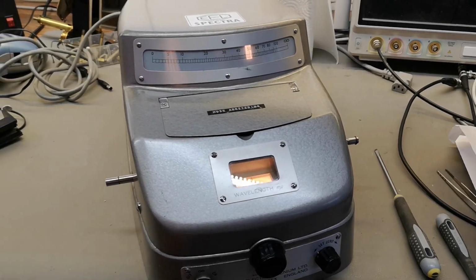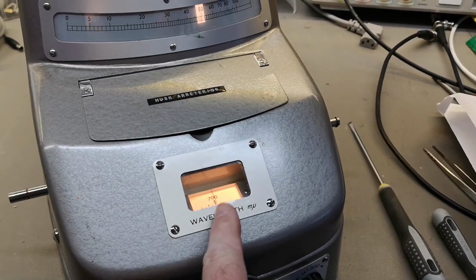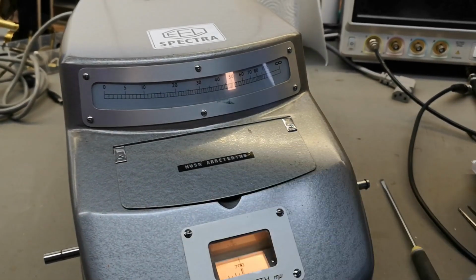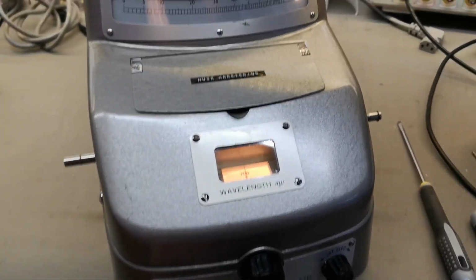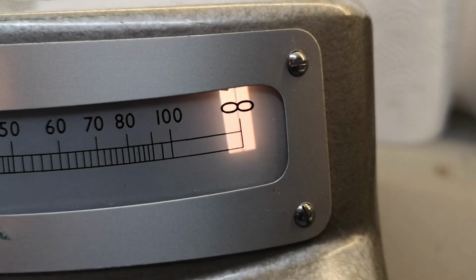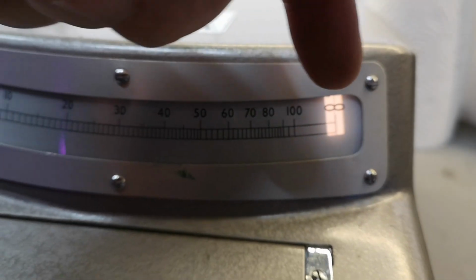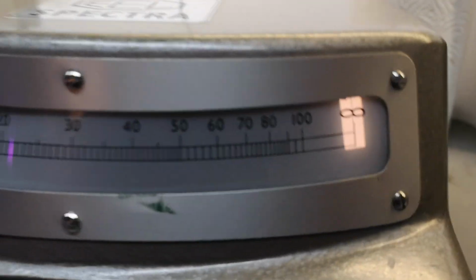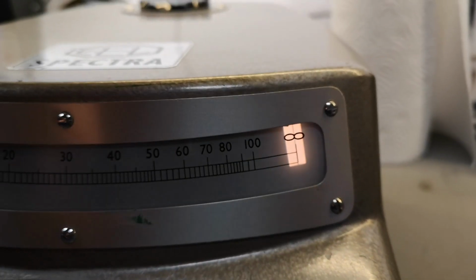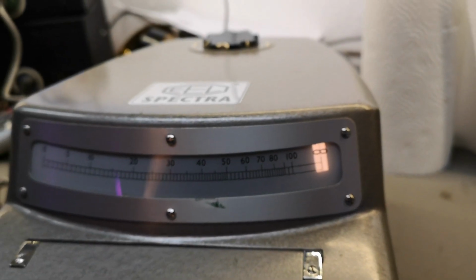So after a little bit of cleanup, it is of course working. So now it is on 700 nanometers, and I get this readout. So let's crank the switch to the calibration. See, I think I did this real nice. There's actually this tiny little line there that is also created by the optics. That is a little bit amazing. I didn't see where that is coming from, so there's probably a thin line in the, I don't know, where is that actually? So let's go in the readout again and see what happens.